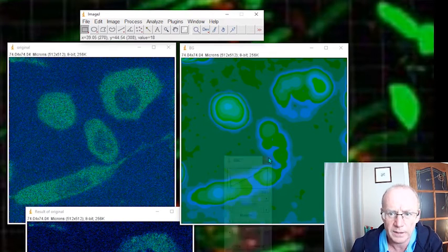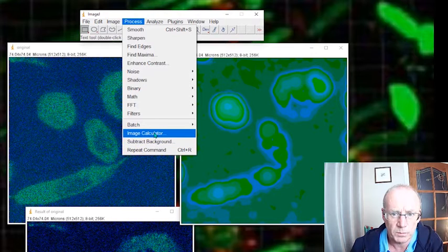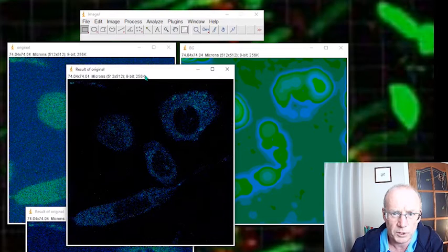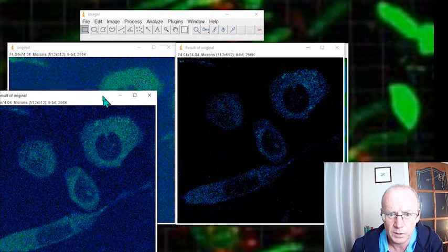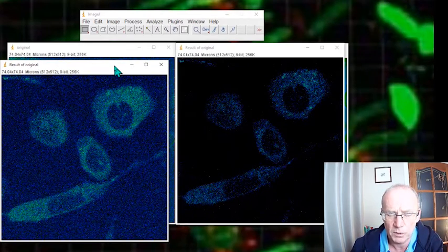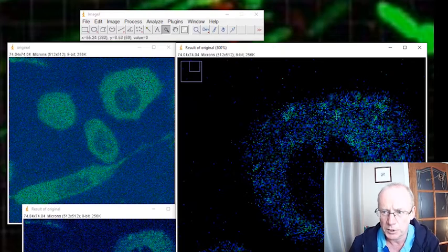Now let's do that image subtraction again. I'm going to the image calculator. I've got my original image. I'm going to subtract from that the background and create a new image. There you go. Now that's quite nice, isn't it? This is the image with the background subtracted. Here we have the original image on the left-hand side, and on the right, I think you would agree, hopefully, quite a clean image.